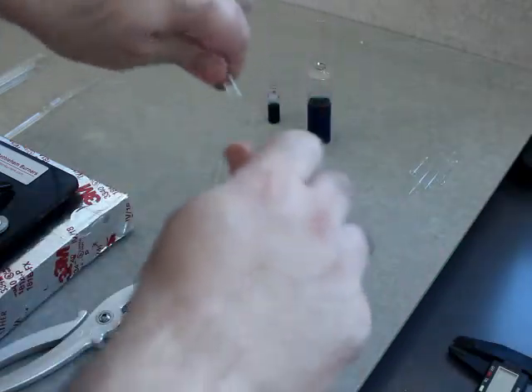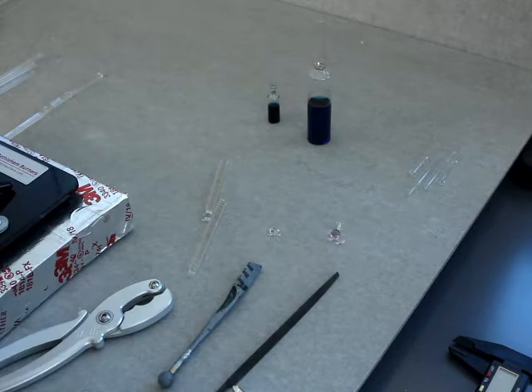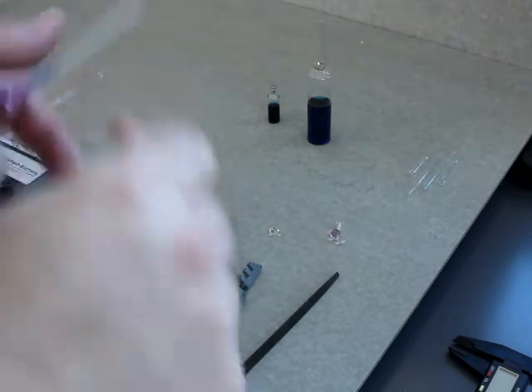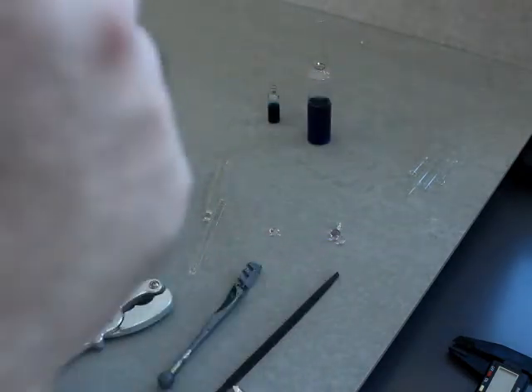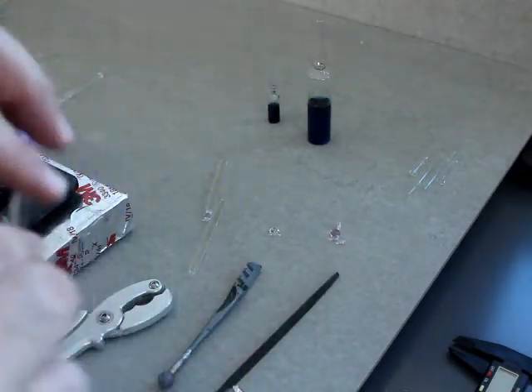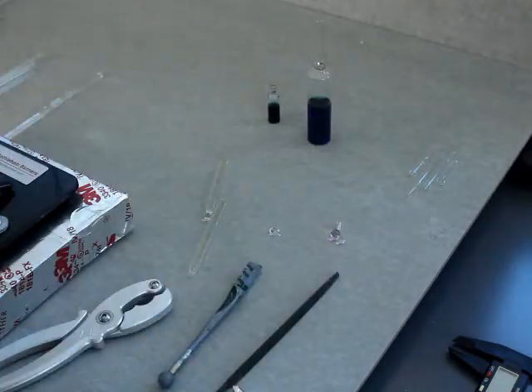It's always a little pop. In that second example I did with the tubing, when I scored it I could feel that it wasn't quite going to break with that small amount of force. If I would have tried to muscle it, I would now be making a video of myself going to the emergency room. So again — just a little pop.